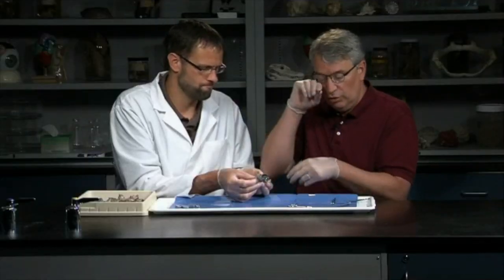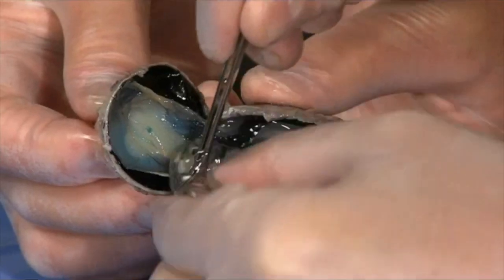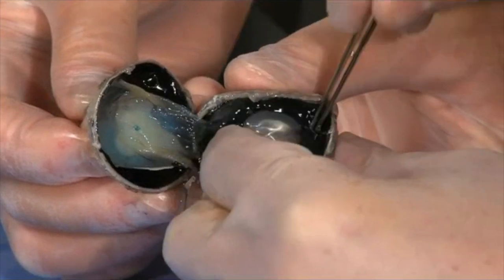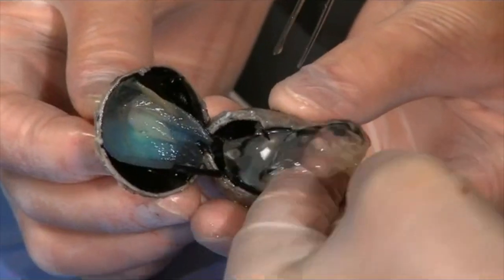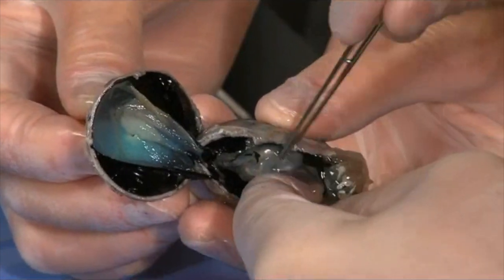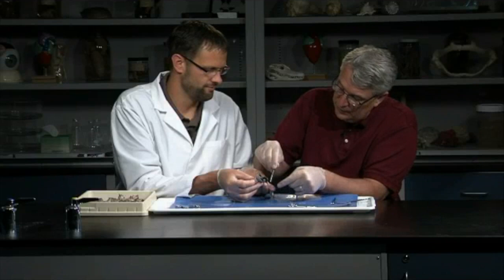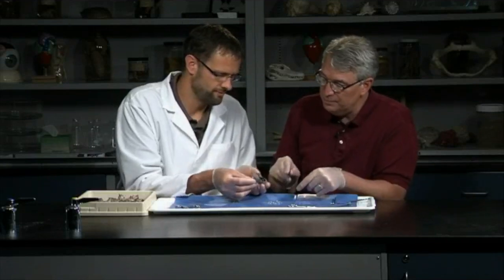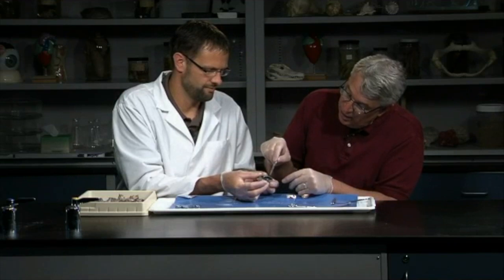So light is transparent, light passes right through that, and so you probably want to just kind of pull that out of there. It's kind of jelly-like. Yeah, it's very jelly-like, and it does kind of want to hang on, so you kind of pull it all out of there. There it goes. Boop. And so it's kind of gloopy. And now we can see some other structures in there.